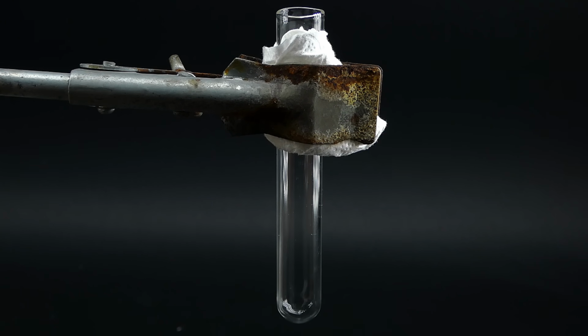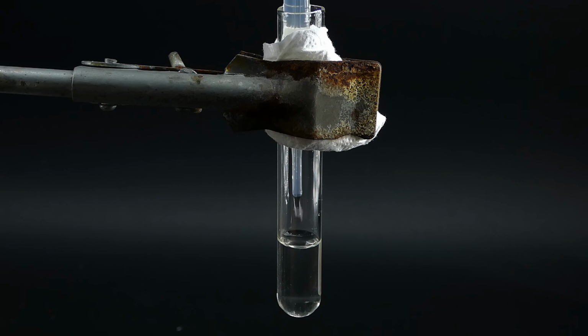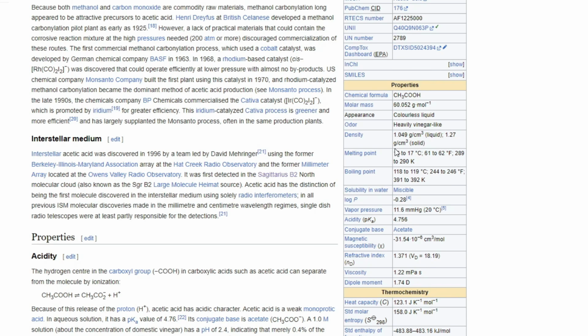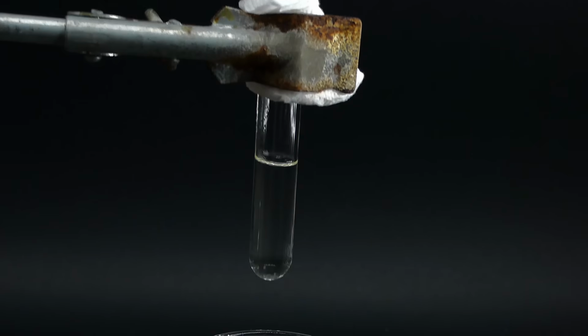Okay, so now I wanted to finally demonstrate the glacial part of this acid, and you probably expected something like it having the ability to freeze stuff, and while that's partially true, because a lot of reactions involving it are endothermic, it actually gets its name from its ability to freeze at a really high temperature of only about 16 degrees Celsius. To demonstrate it, I poured some of my glacial acetic acid into a test tube and lowered it into some ice-cold water.